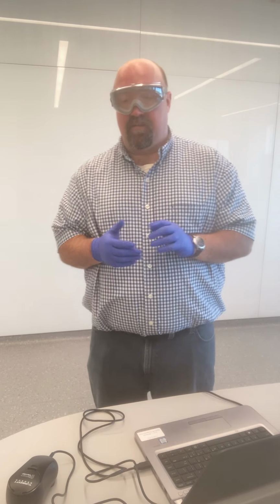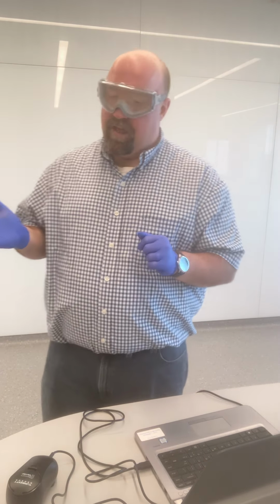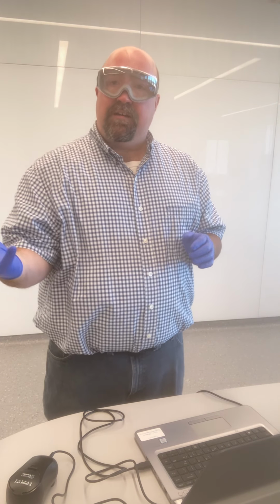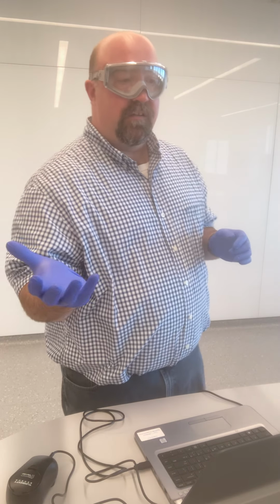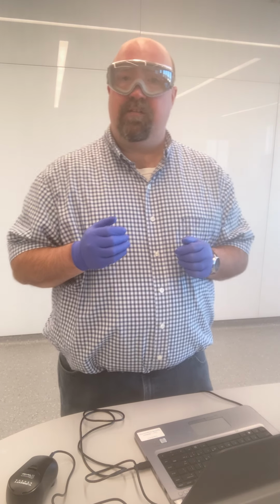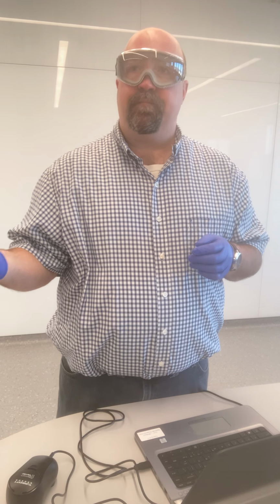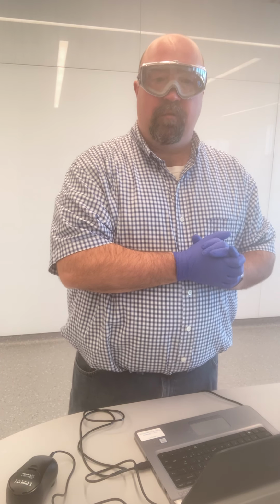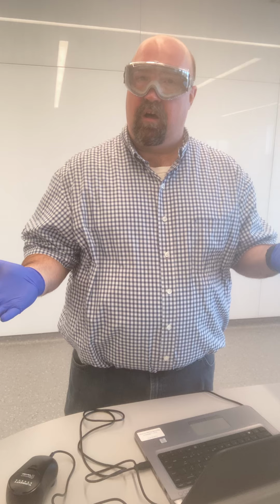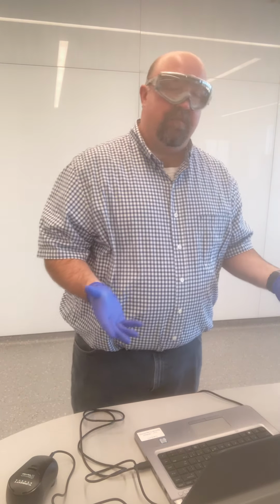The way that TSS is measured is we take a liter of sample and filter that down through a filter, and that will collect any of the solids that were suspended in the sample. Then we're able to dry the filter and compare the mass of what we have back to what the mass was of the filter paper before it had any solids on it. And so what we actually have here, we've done all of that already.